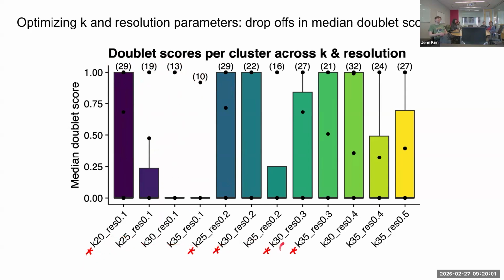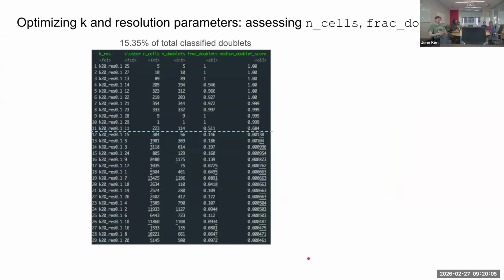So then we focused in on these 5 K-res combinations a little bit further. So you can look at each of the K-res combinations. I'm starting with K20, resolution 0.1, and you can see, if you sort the clusters by the median doublet score, there's this stark drop-off at 0.684 down to clusters that have around 0 median doublet scores. And we see that these first 11 clusters have not only really high median doublet scores, but also high proportions of originally labeled doublets. And together, if we were to drop these clusters, they would make up around 15.4% of the total original labeled doublets that the scDblFinder class gives you.